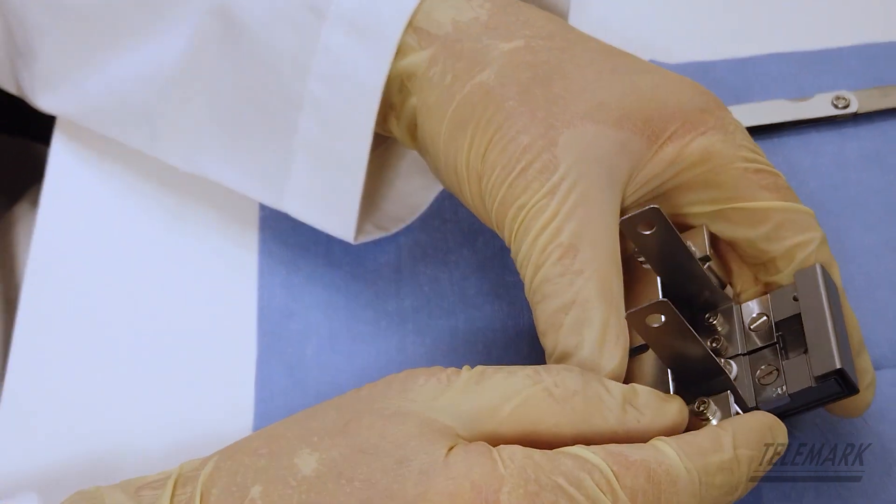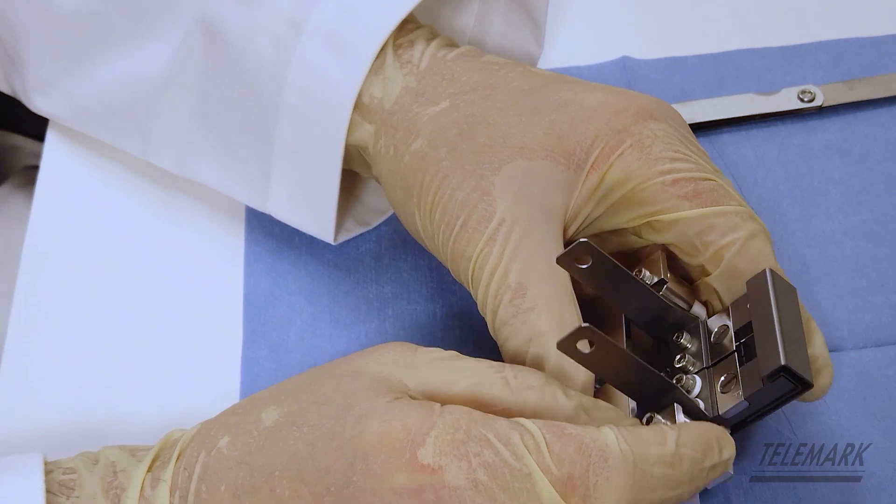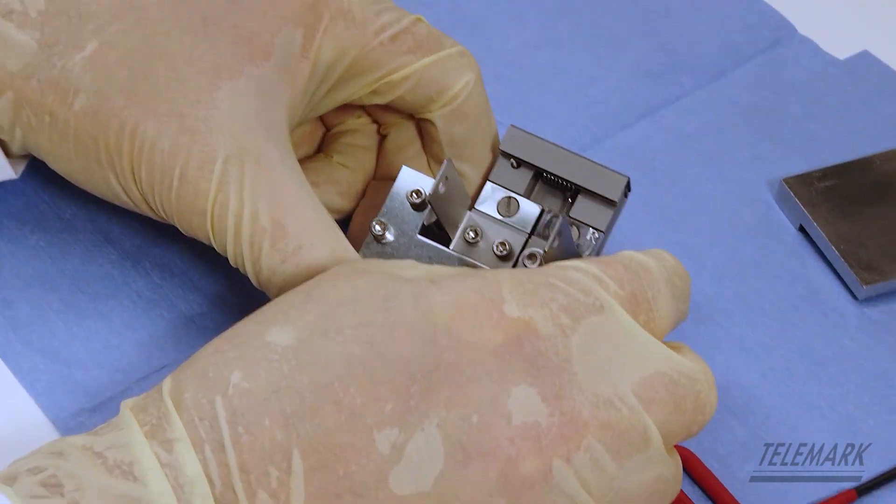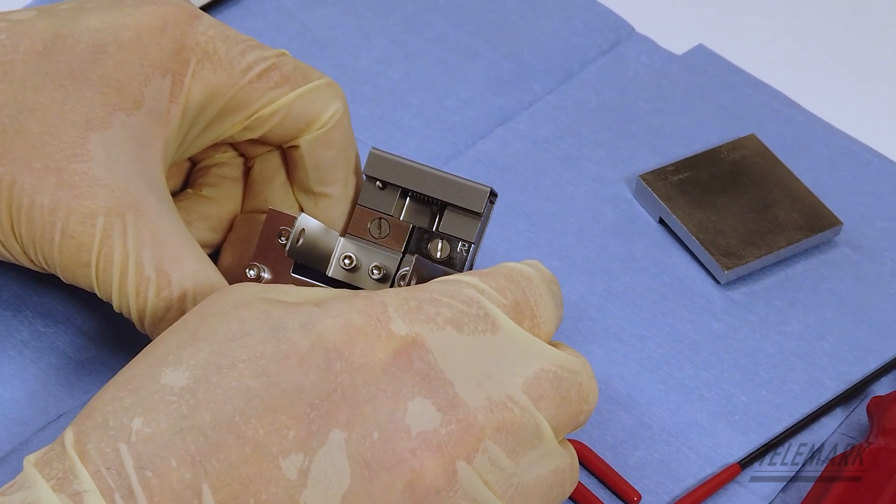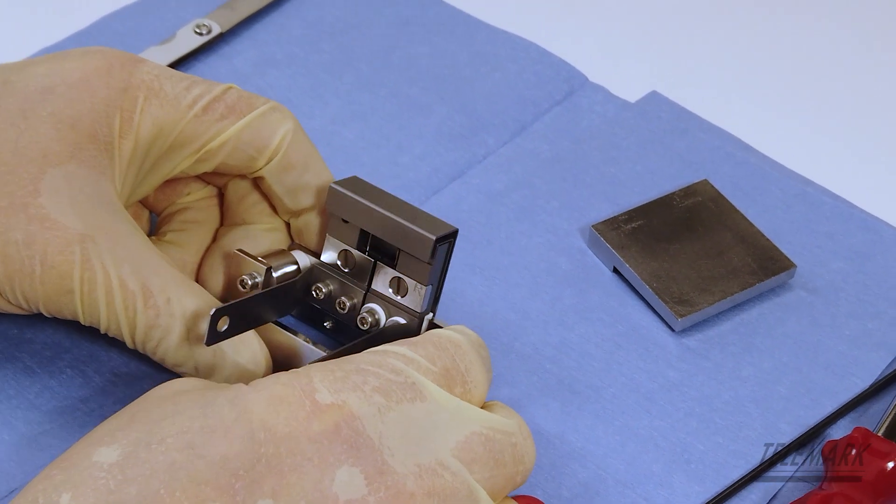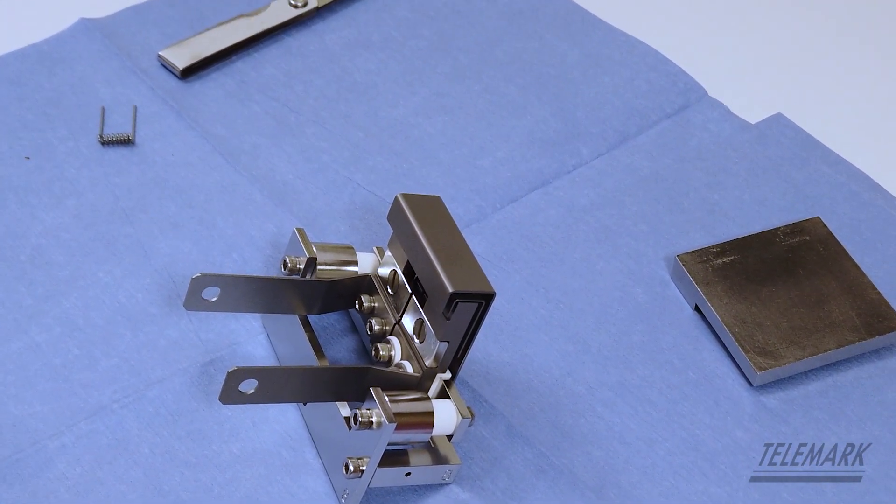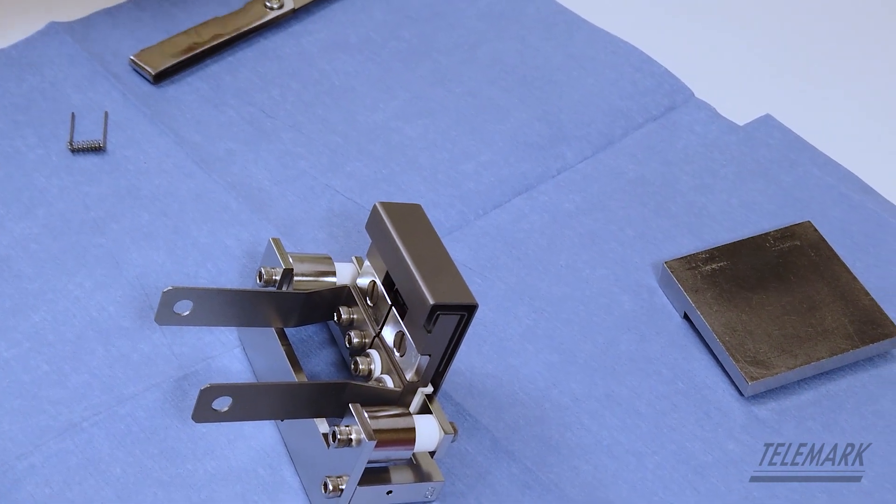And you just take a look. You want your beam former about the same height as your anode and square. And that should give you a serviceable 273-0150-8 emitter.